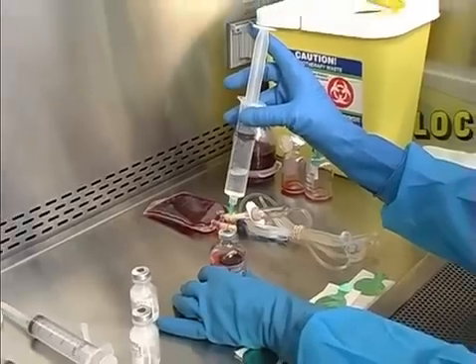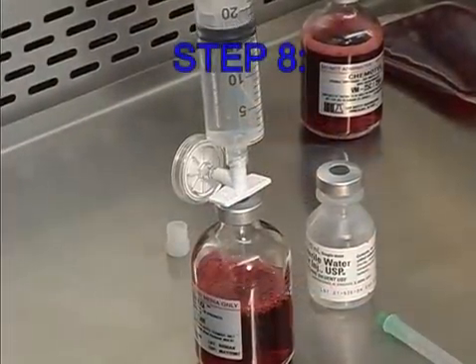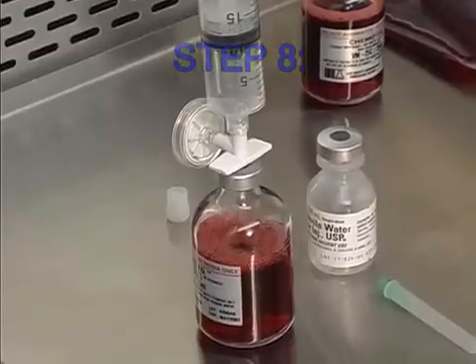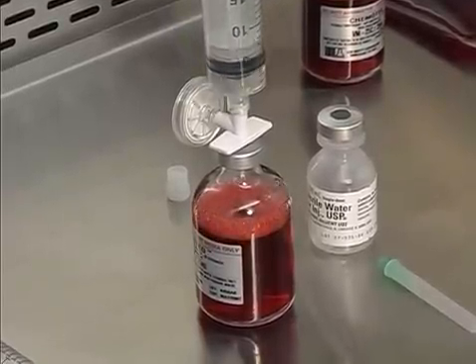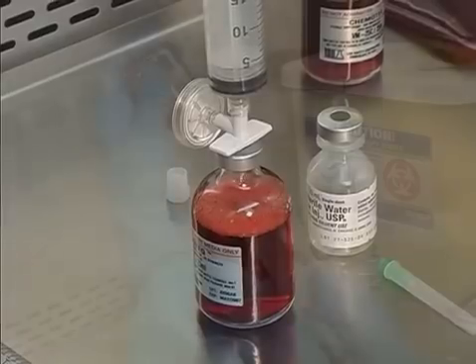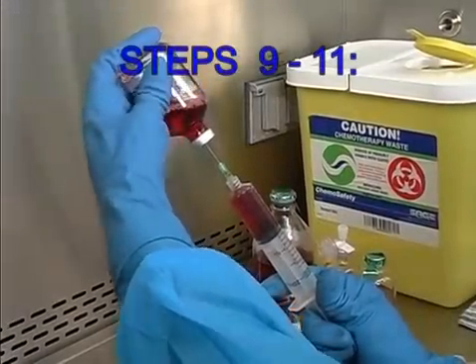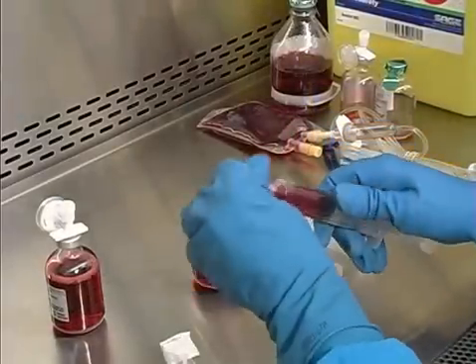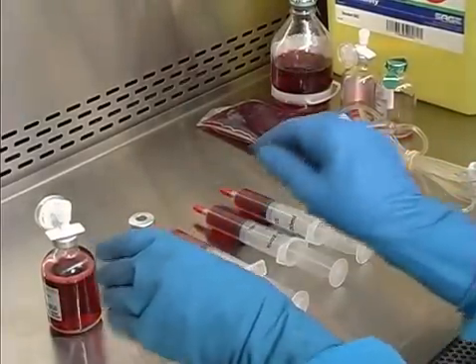Step 7: Without using a dispensing pin, add 25 ml's of sterile water for injection to one of the VM 25 vials. Step 8: Using a dispensing pin, add 25 ml's of sterile water for injection to the other VM 25 vial. Steps 9 through 11: Without using a dispensing pin, prepare 3 each 10 ml syringes from the VM 25 vial diluted in step 7.